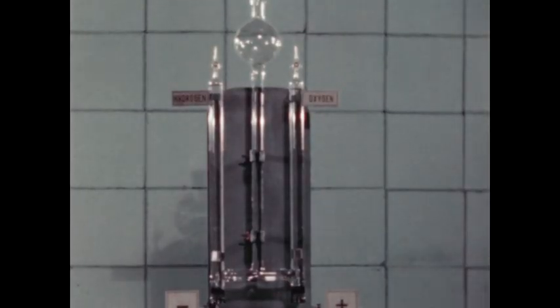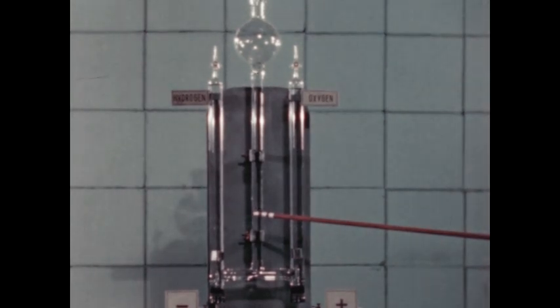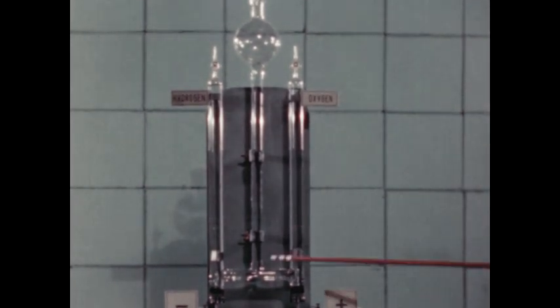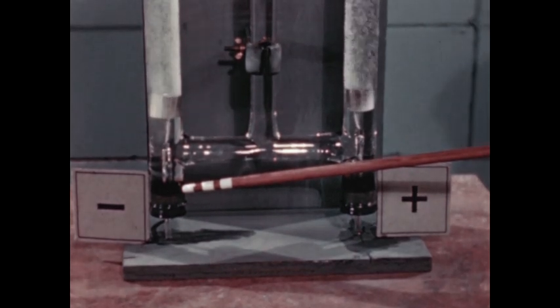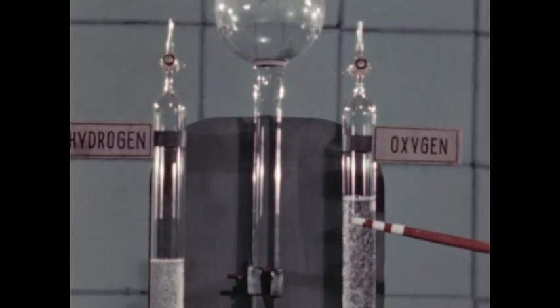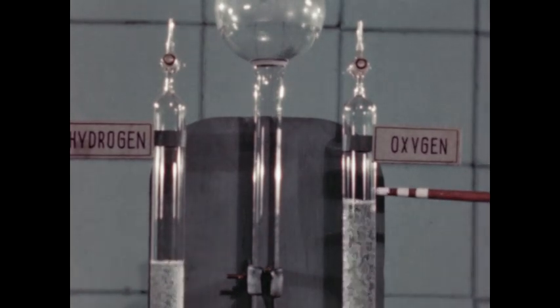Another way of producing pure oxygen can be shown by this electrolysis apparatus. The H-tube is filled with water containing a little sulfuric acid to make it conduct electricity. When electric current is introduced, the water is decomposed into its elements — hydrogen and oxygen. The decomposition of water produces twice as much hydrogen as oxygen by volume.